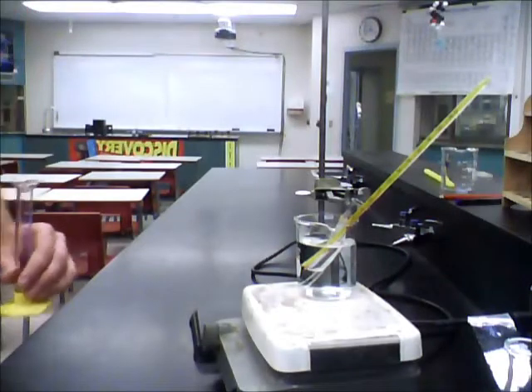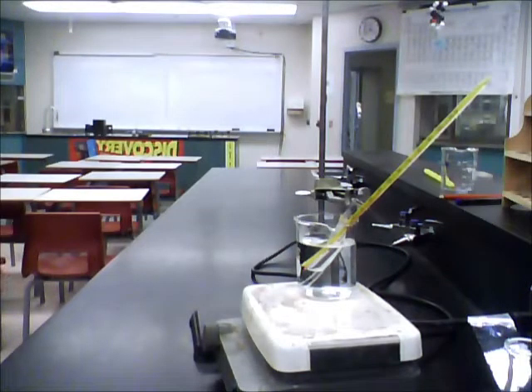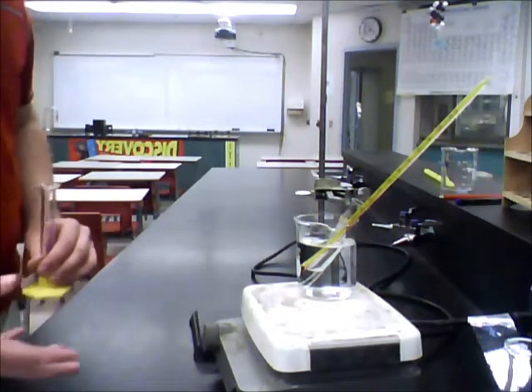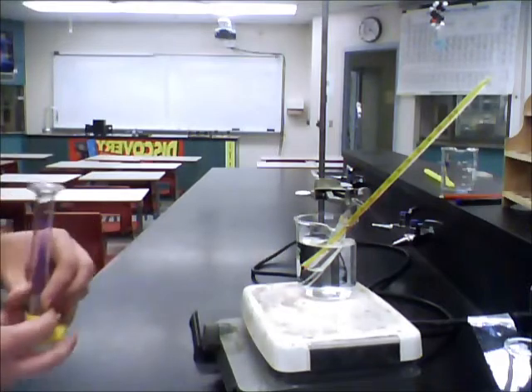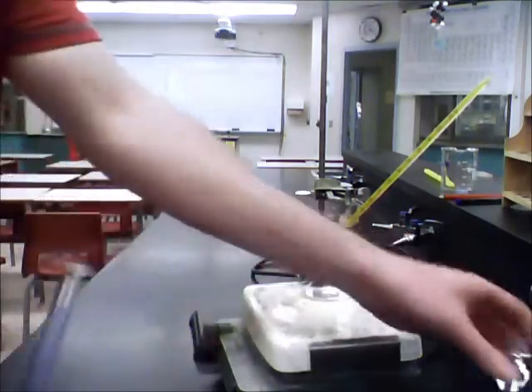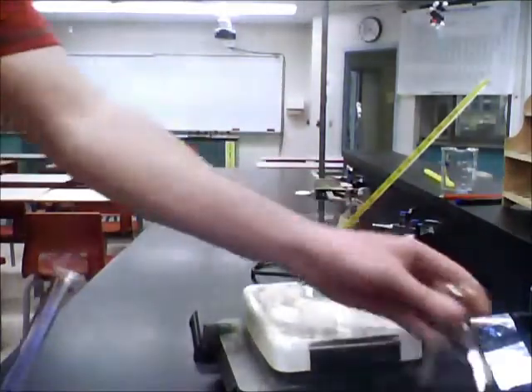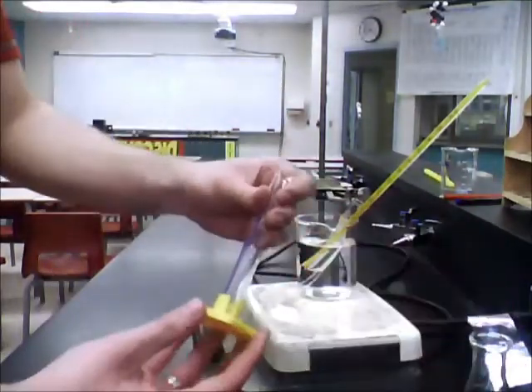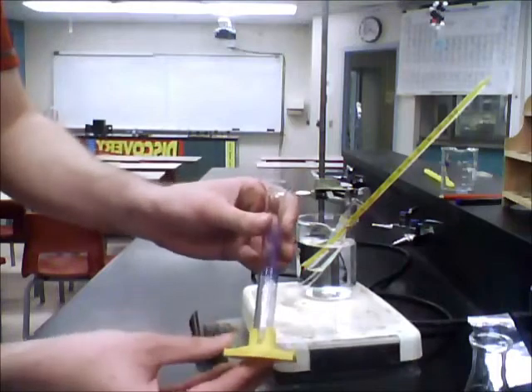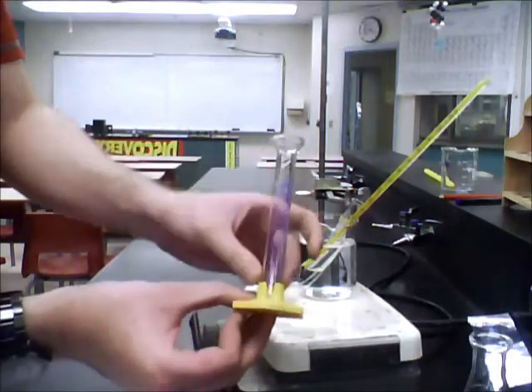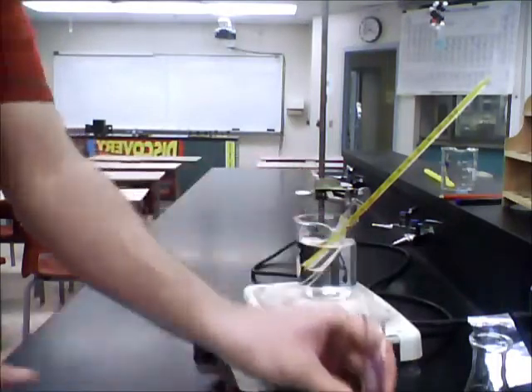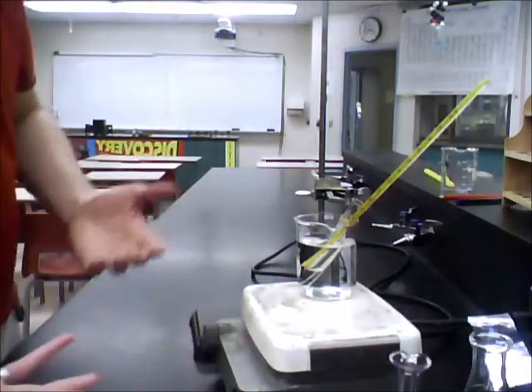Hi ladies and gentlemen. Today we're going to be looking at the boiling points of various alcohols. First things first, you need to grab some alcohol. In this case, I'm starting off with methanol. What you need to do is put around three milliliters of the alcohol into the graduated cylinder. Make sure you're not using too much because for this experiment we're not going to be using a whole lot.